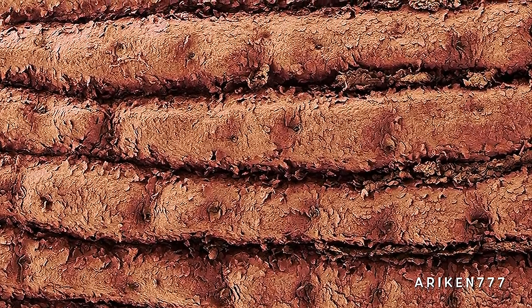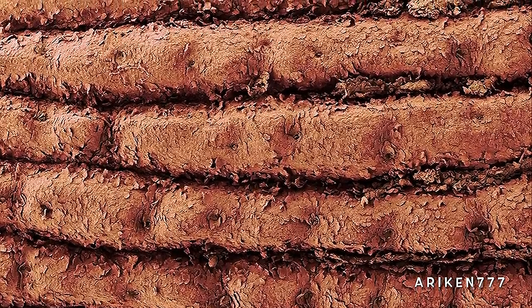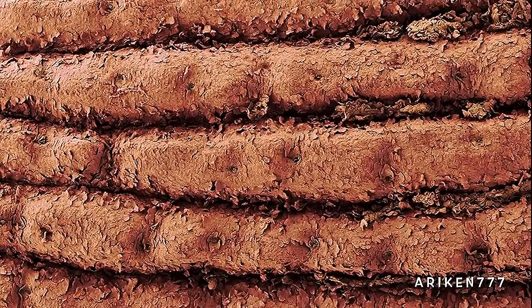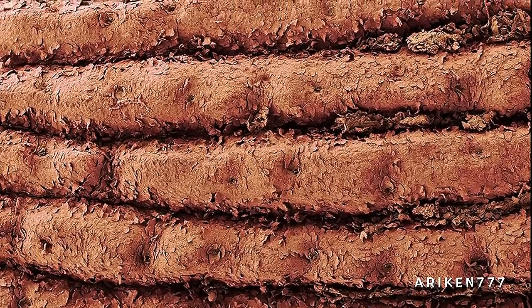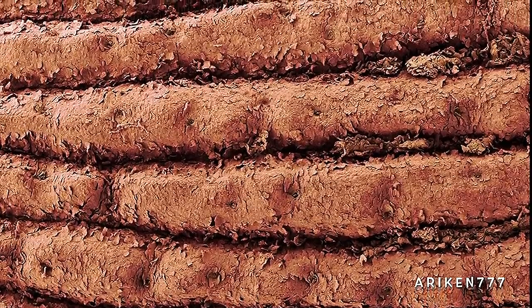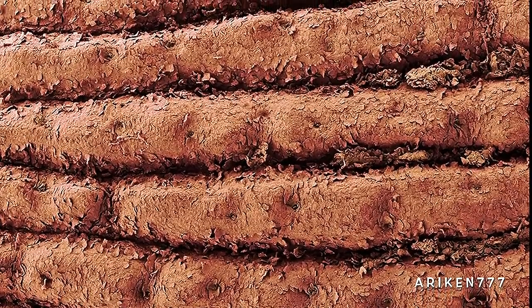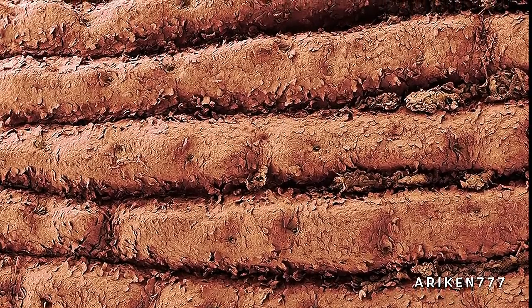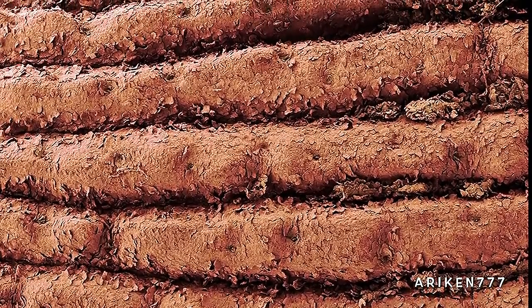A part of a human fingerprint showing details of skin ridges in the outer epidermis. The small circular apertures on the ridges are the openings of sweat glands. Epidermal ridges occur on the soles and palms and they form a distinct pattern. Each fingerprint pattern is unique to an individual. Even identical twins have different fingerprints.